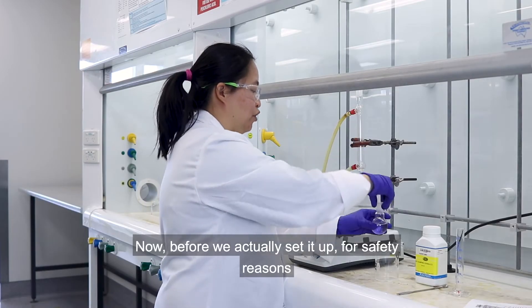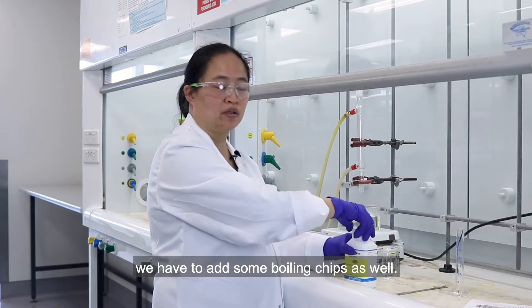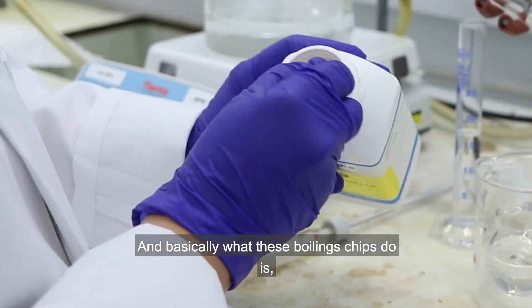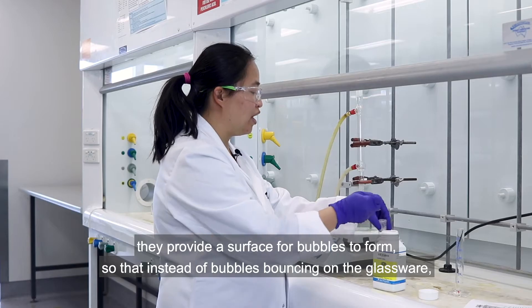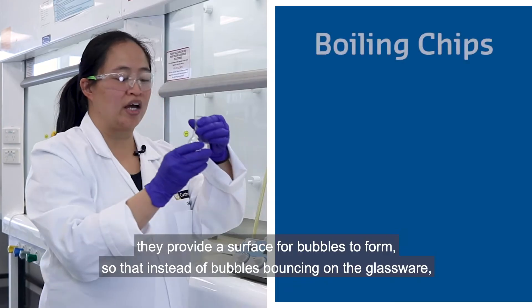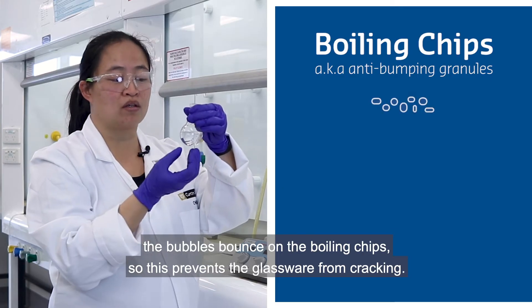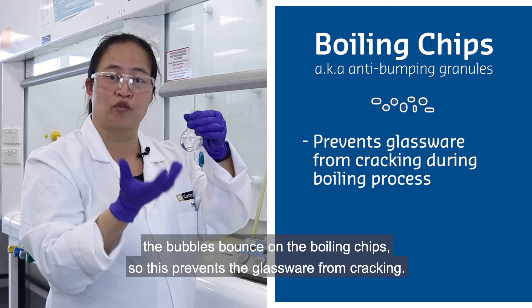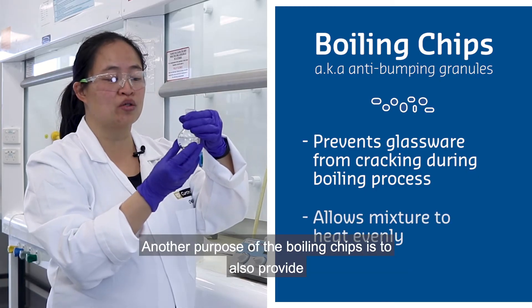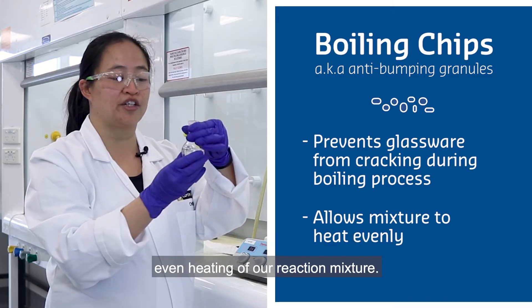Now before we set it up, for safety reasons we have to add some boiling chips. Basically what these boiling chips do is they provide a surface for bubbles to form, so that instead of bubbles bouncing on the glassware, the bubbles bounce on the boiling chips. This prevents the glassware from cracking. Another purpose of the boiling chips is to also provide even heating of our reaction mixture.